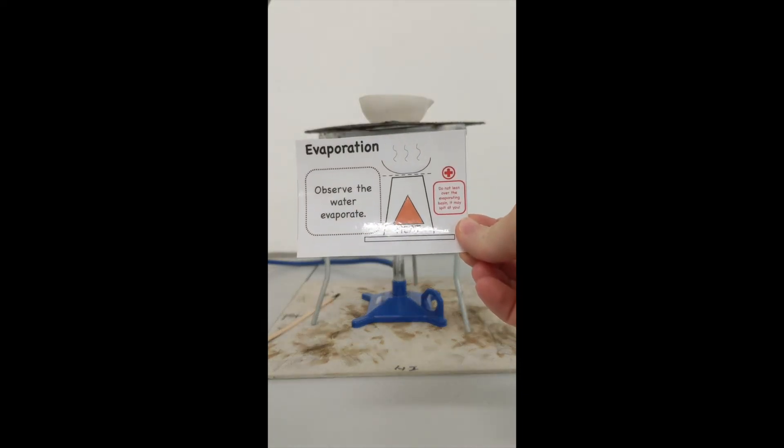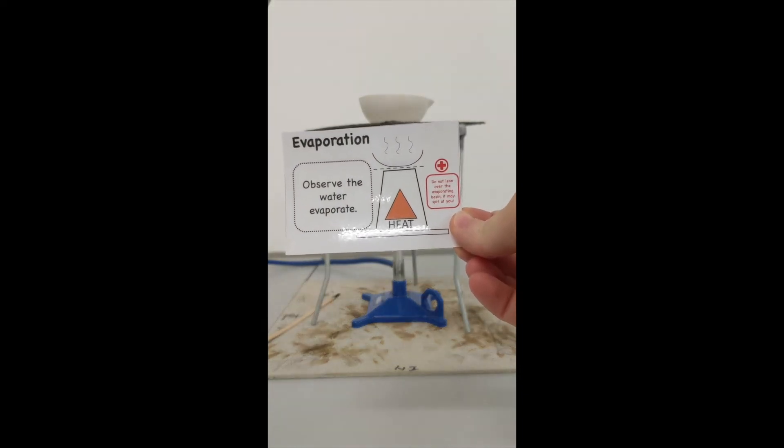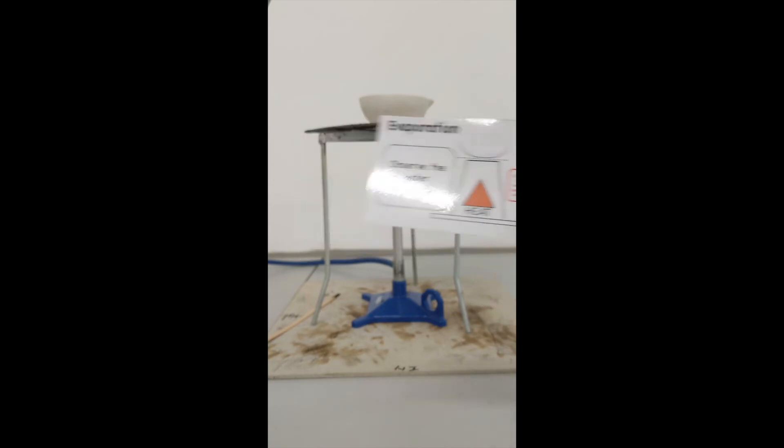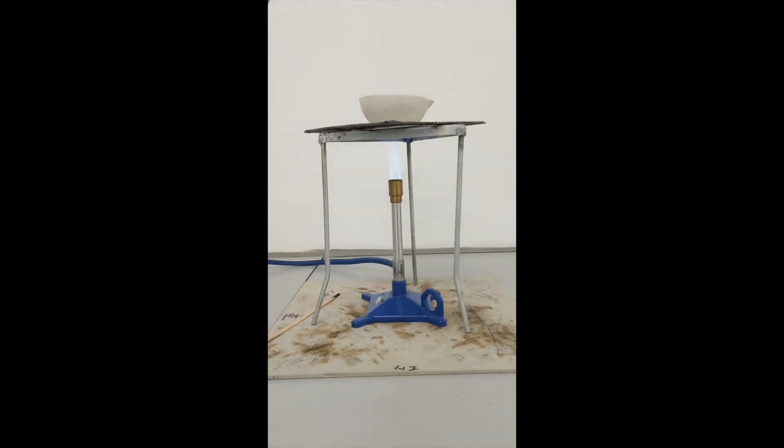From a safe distance, I'm going to observe the water evaporate. I'm not going to touch the evaporating basin or any of the equipment whilst this happens, as it's very hot and I don't want to burn myself.